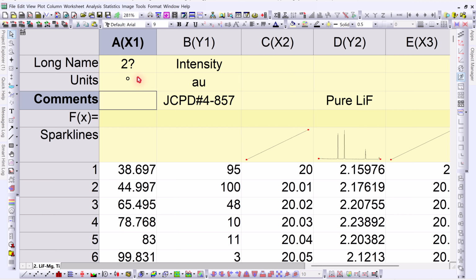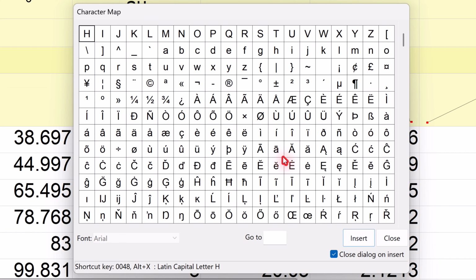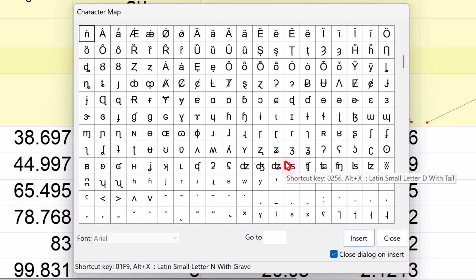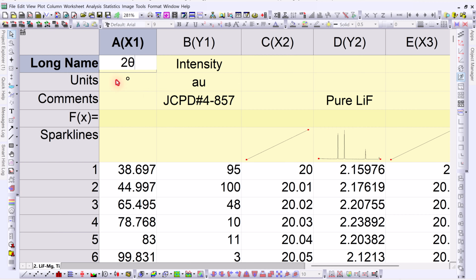So let's understand why this happens. Basically what we did earlier was we inserted the symbol using the character map. For example, we inserted theta from the character map and then saved the project. Sometimes, if we just close and reopen the file, it works fine. But if the system restarts, memory refreshes, or cache gets cleared, then these symbols may disappear and turn into question marks.